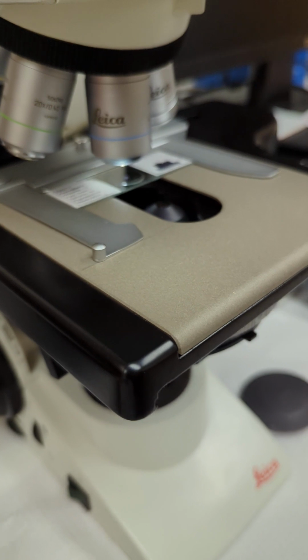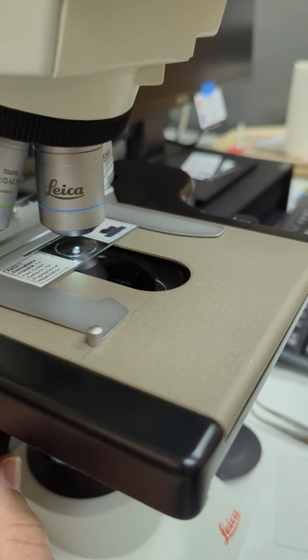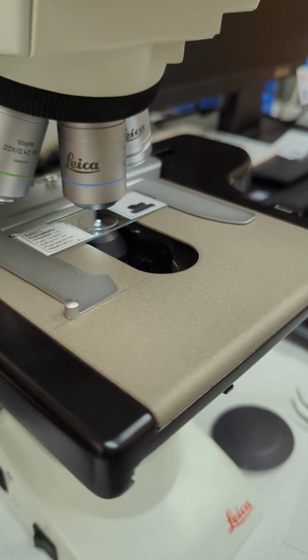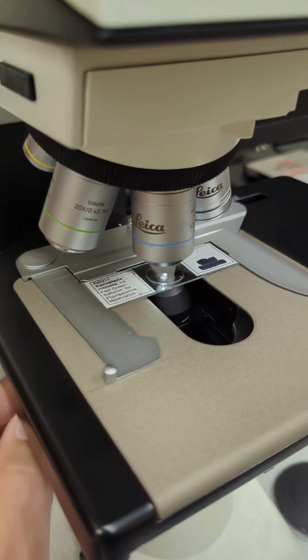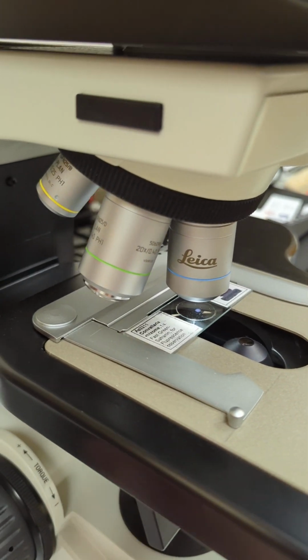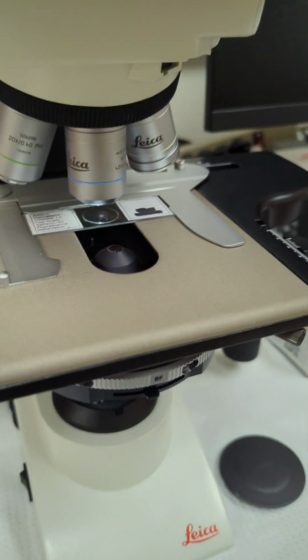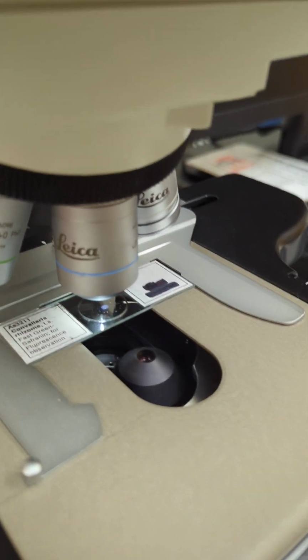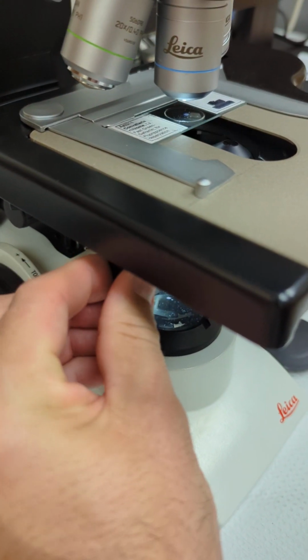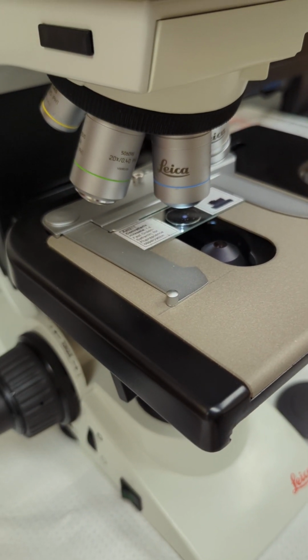One thing I did forget to tell you in the beginning was make sure you use this condenser head flipped in. Okay, that should always be flipped in for Brightfield on all lenses that you have here. The only reason you'd flip it out is for fluorescence, and if you had something lower than a 5x lens on here, like a 2.5x lens, then you would flip out the condenser head there, using that lever here, so that it's not in the way of the fluorescence, and then it also gives you maximum field of view for a lower mag lens.